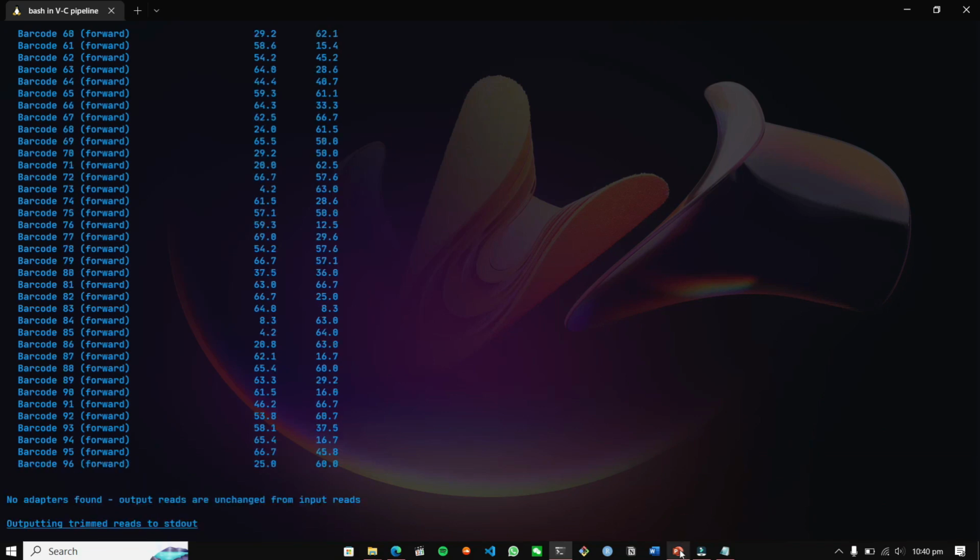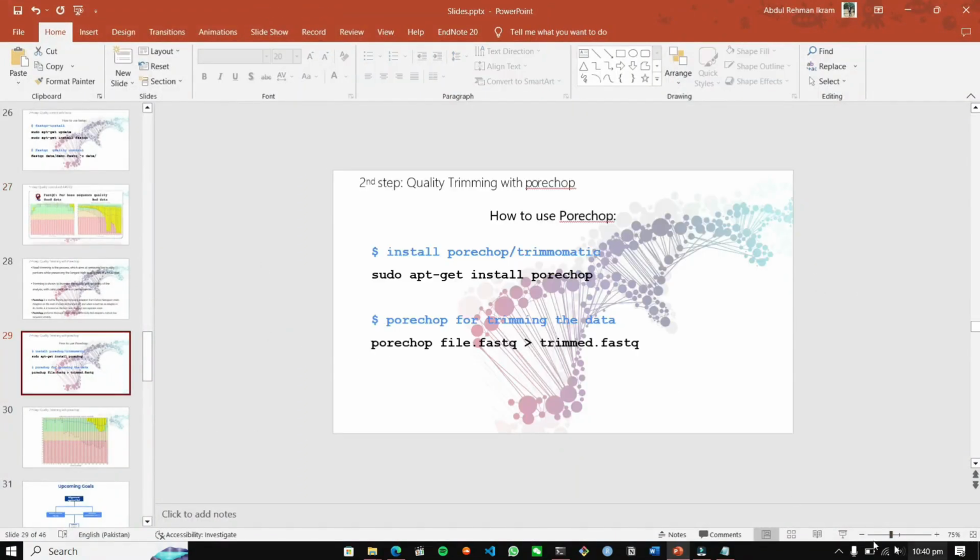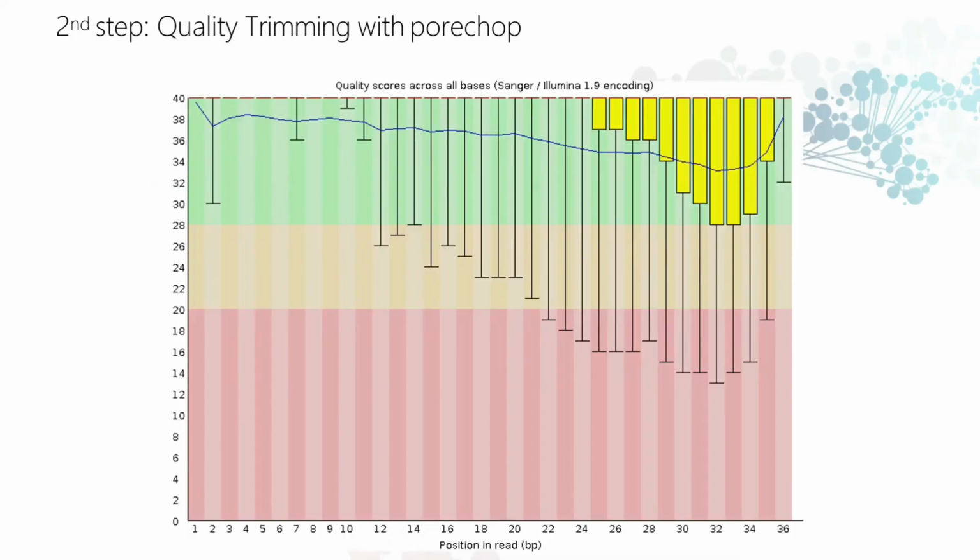So basically, this is what quality trimming does. Here you can see I have the bad quality data. By using Porechop, I can get the good quality data just like this. What it does is trim out the danger zone, and the middle zone data, into good quality score data. For example, here you can see that we only got the quality scores that were above the threshold, the set threshold for the Porechop tool being 5, and there are no adapters in these sequences. These are the pure sequencing data that we can get.